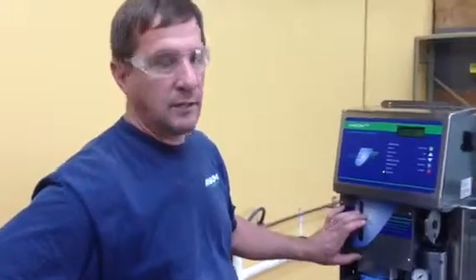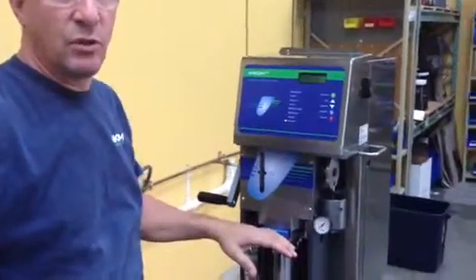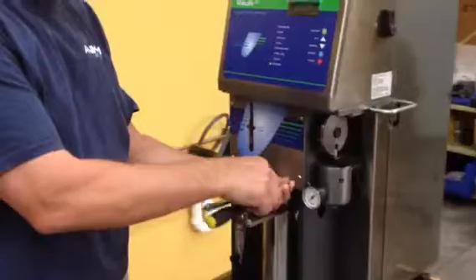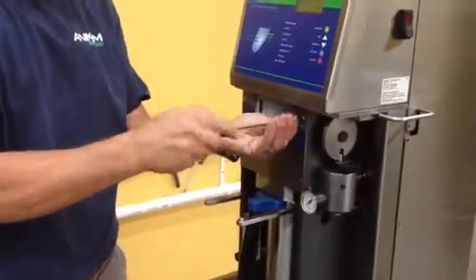First thing I want you to do is take off the front plate here and the back cover. Try to get in position so it's easy for you to get to that back cover. Front plate has the 4 screws in the front. Just take those screws out. Make sure you don't drop them and lose them.